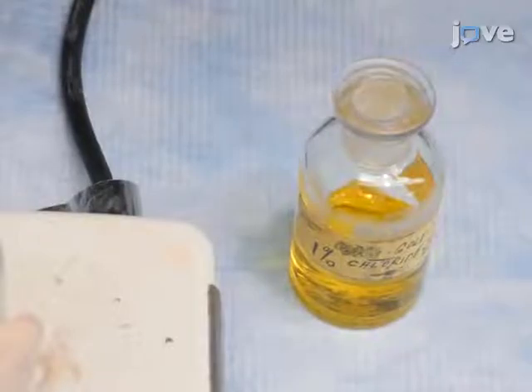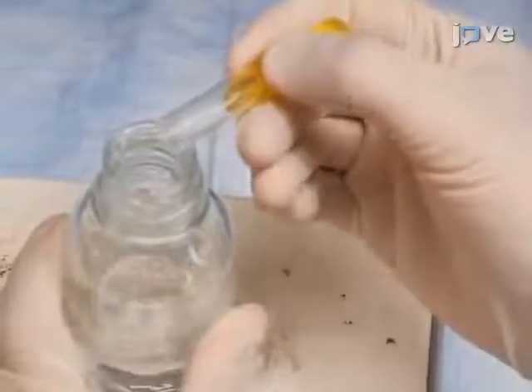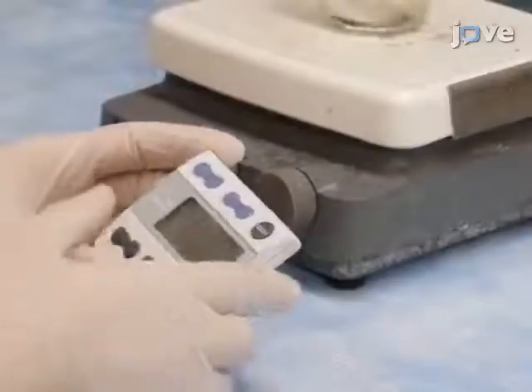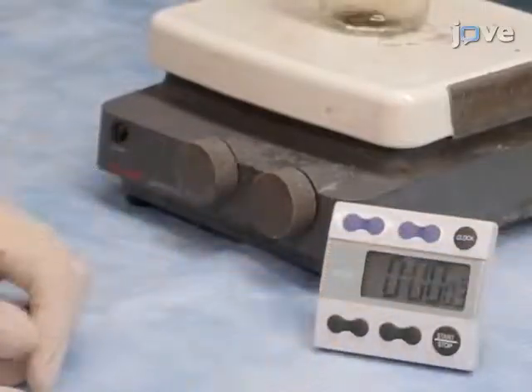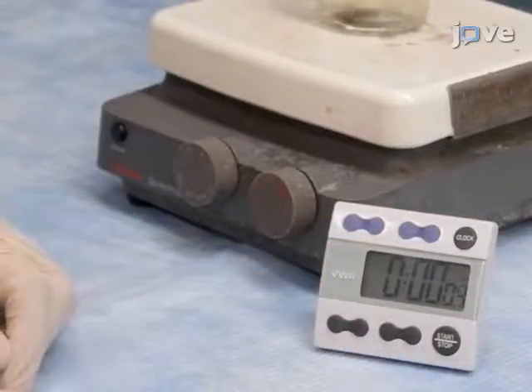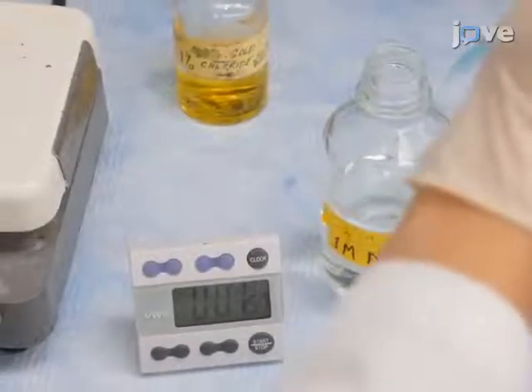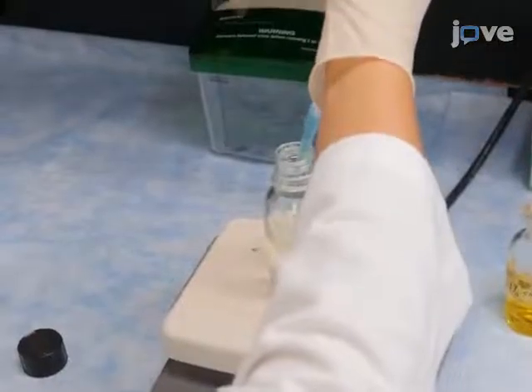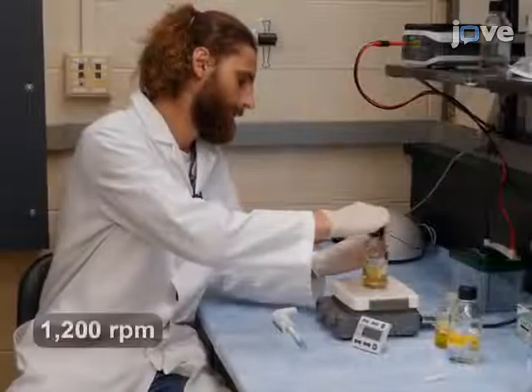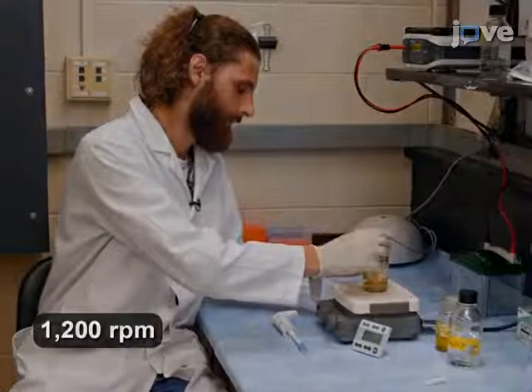Next, add 2.8 milliliters of the gold chloride solution to the bottle, which begins the delay time that determines the size of the oligoclusters. Add 700 microliters of the sodium thiocyanate solution to the bottle at the end of the delay period. Continue stirring overnight to complete synthesis of the oligoclusters.